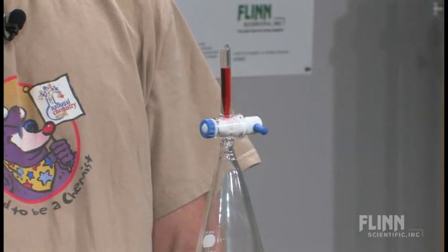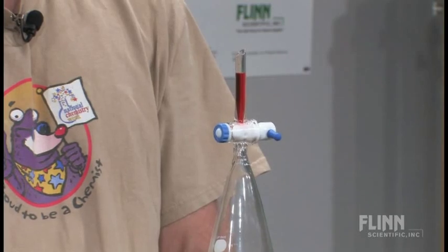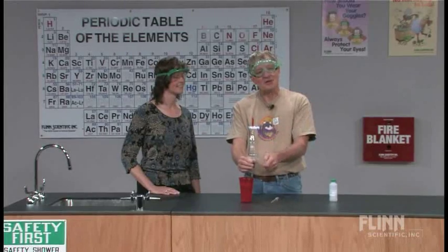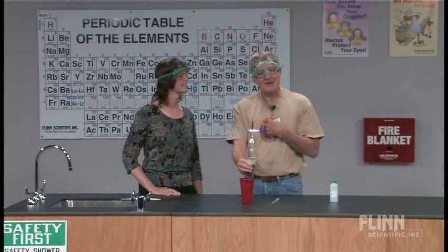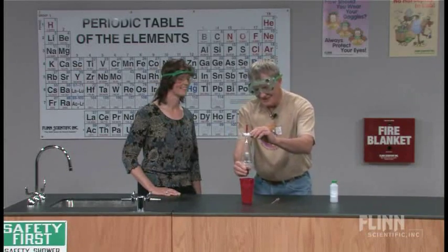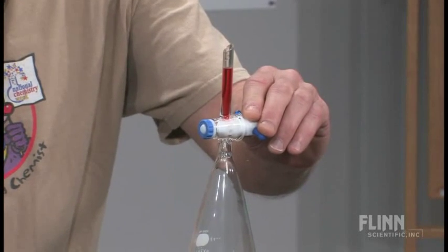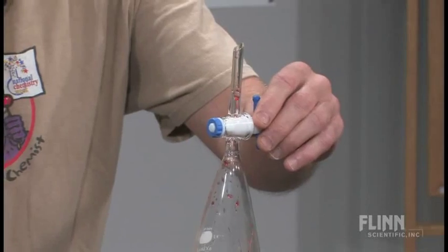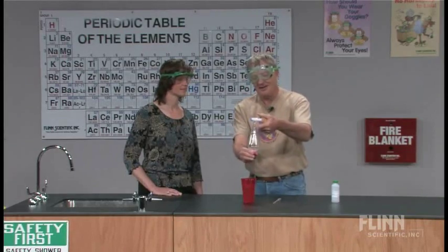Now, there's some of you sitting out there looking at this and going, this is one of those demos that will never fail, because when I open this, gravity's going to pull the liquid in anyhow, and it won't matter. Do I care about that? No. But if I do open it, not only do you get the liquid pulled in, but you get the sound that goes with it, so you've got both of them going on, and that's kind of cool.